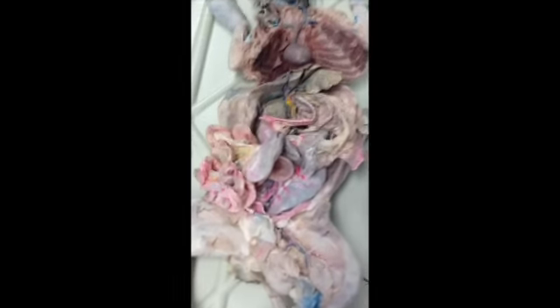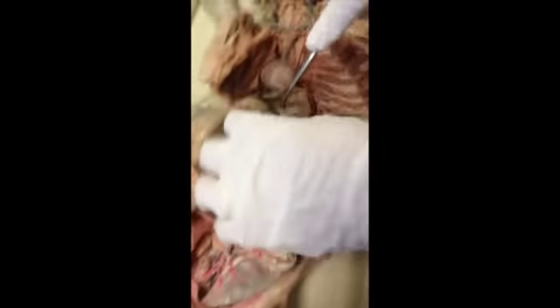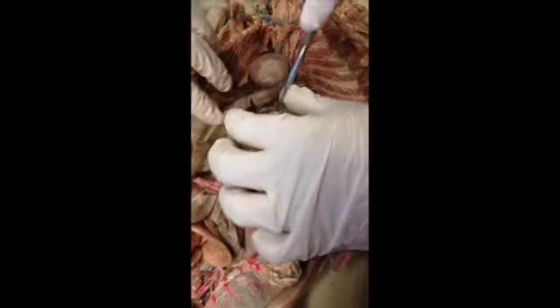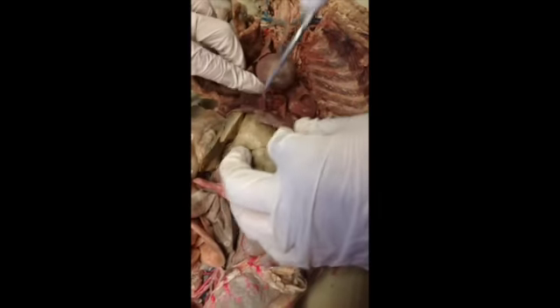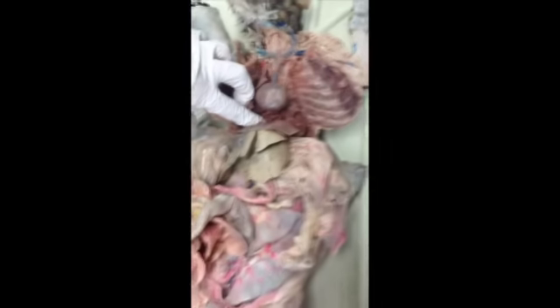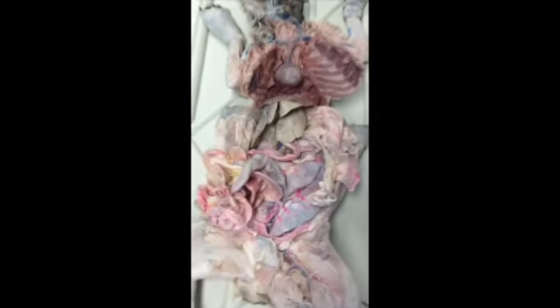Anything else? No. Which one's the hepatic vein? We don't have to know it on the cat, but on the people, you can see it here. It's a vein going into the liver at the top from the vena cava. Or, well, it's leading to the vena cava.